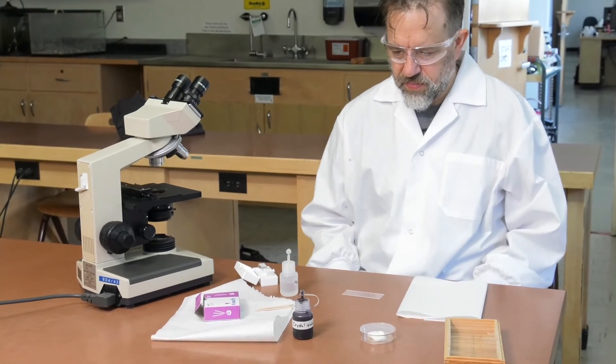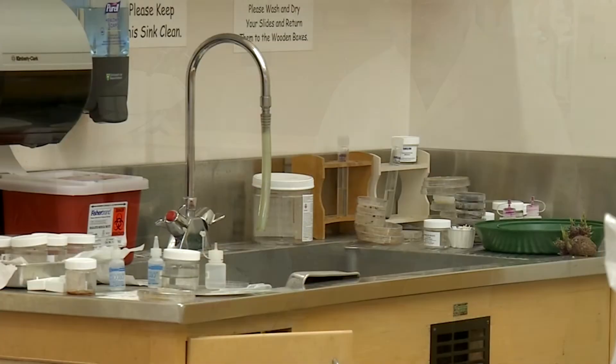All of the materials we use here will be available in your lab room. Your TA will indicate their location during your lab, which is typically next to one of the sinks.